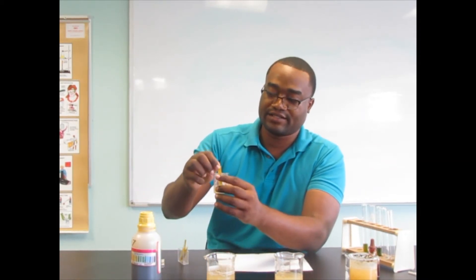For the second set of tests, we are going to use litmus paper. We are going to dip them directly into the samples and then compare the color changes.